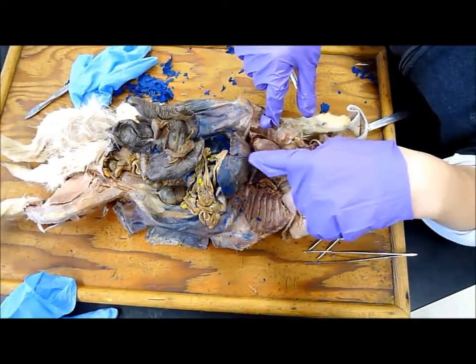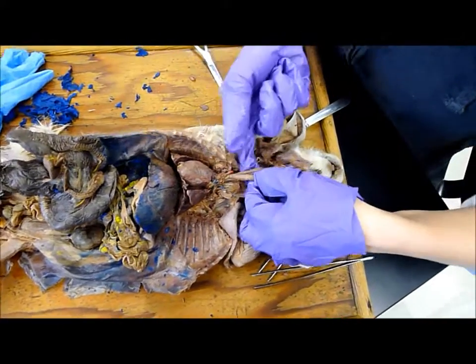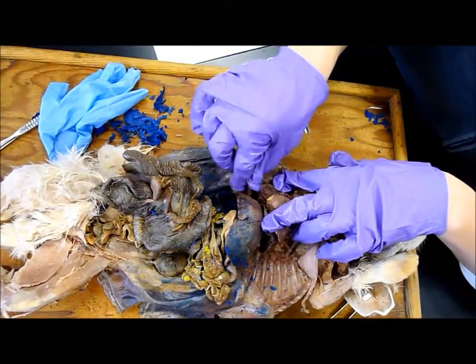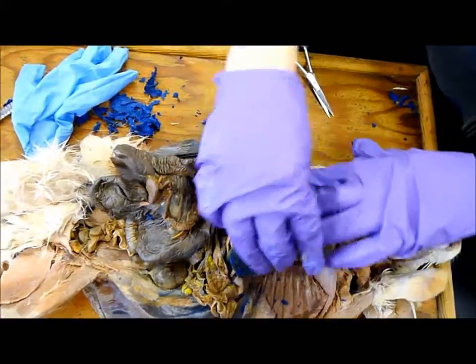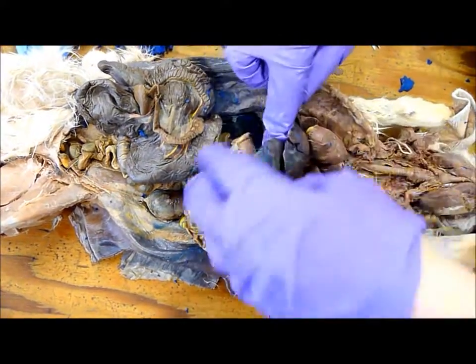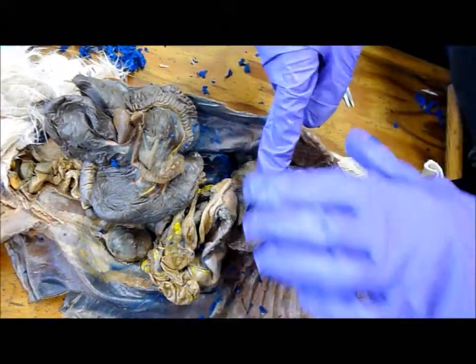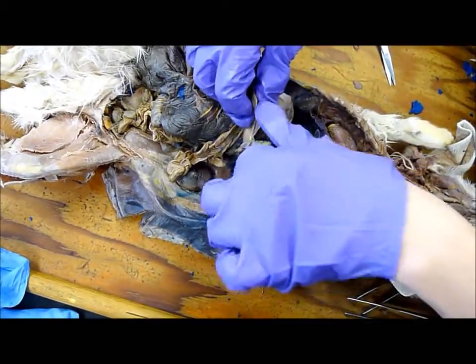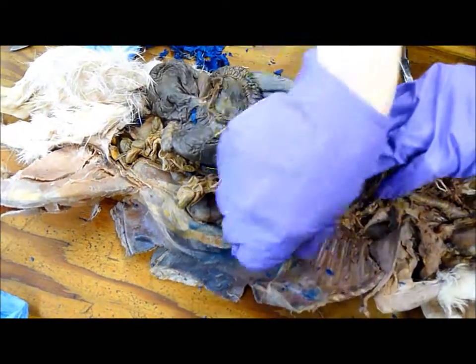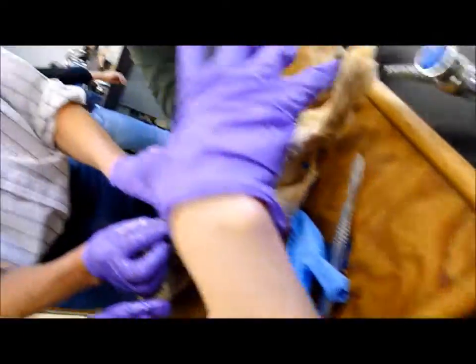Like the liver, like the lungs, and the heart, and the trachea, and the esophagus, and the diaphragm, and the falciform ligament, and the liver, and the gallbladder, the stomach, and the spleen. That little thing — sacculus rotundus. That's what I think. It is.